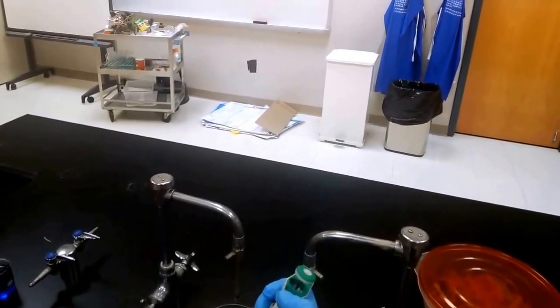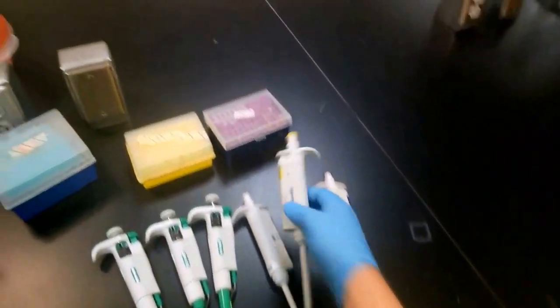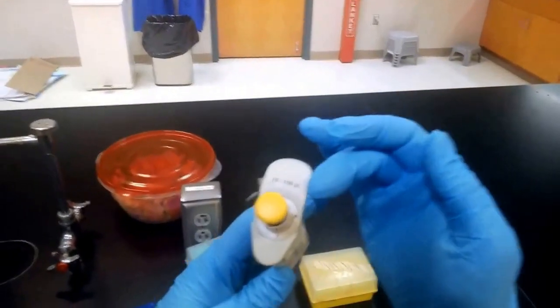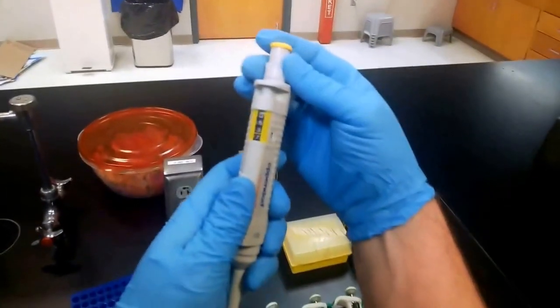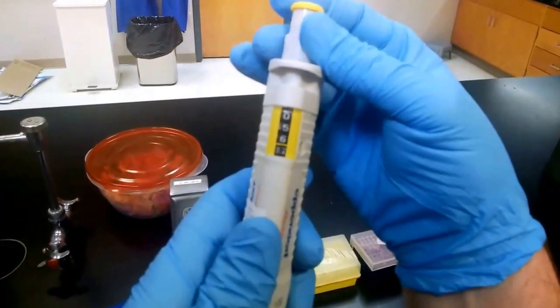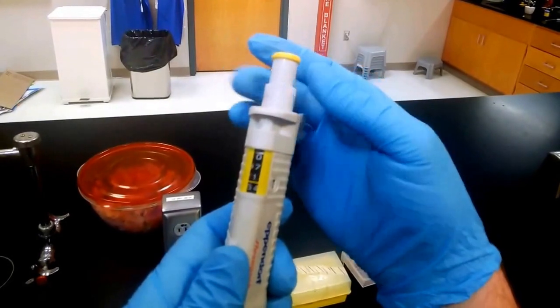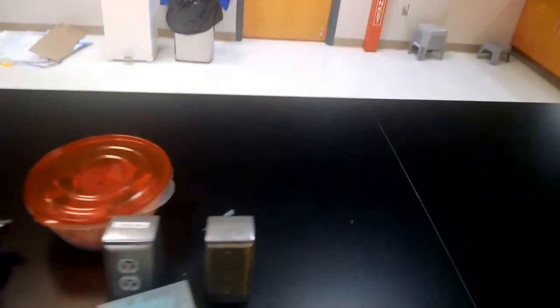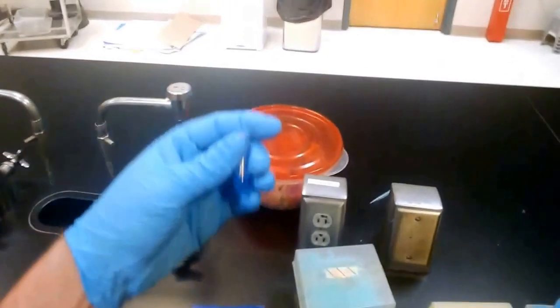All right, let's try that with our Eppendorf micropipette. Now this is the middle of the range, and we're moving 75 microliters—of course it's 10 to 100, so this is the appropriate micropipette to use. And so we'll just roll this up to 75. There we go. And we'll open up our box of yellow tips, press to get a tip, close the lid back so that it stays sterile. We'll open up our tube that we're pulling from with a click thumb flip.